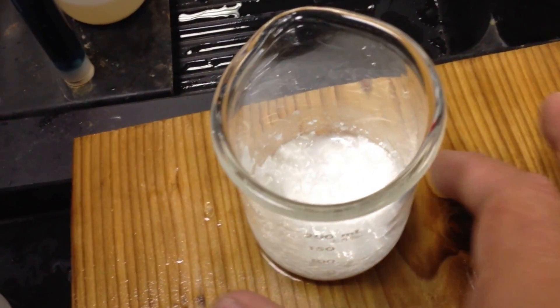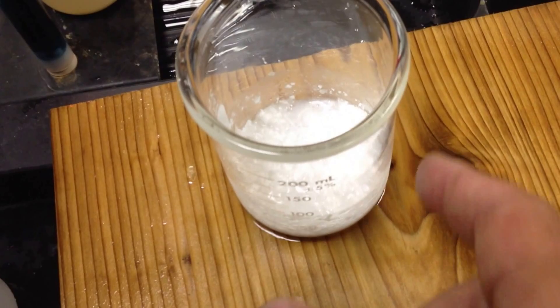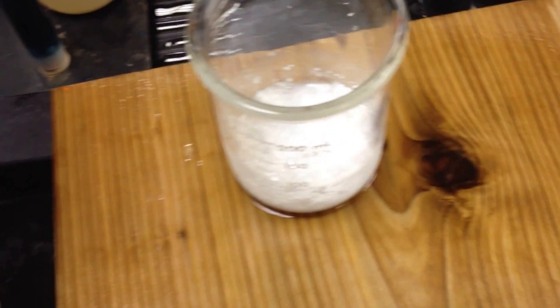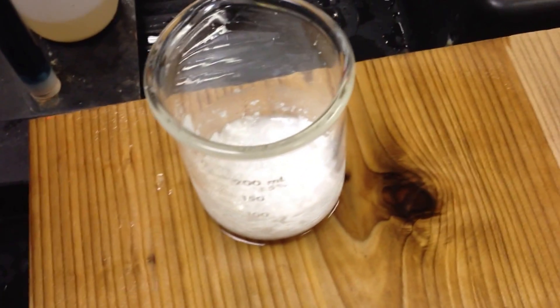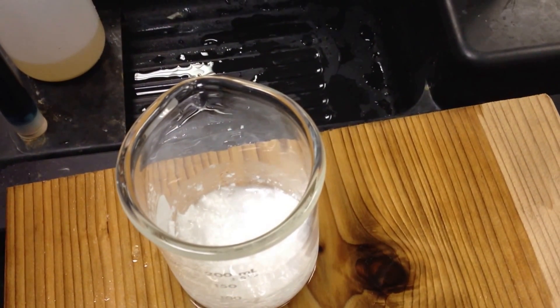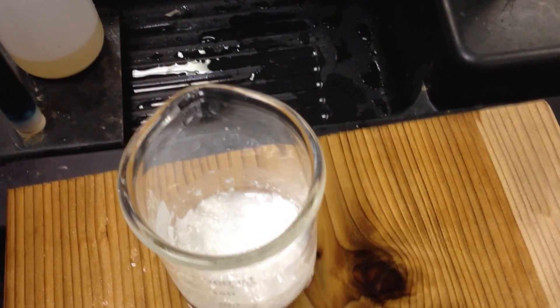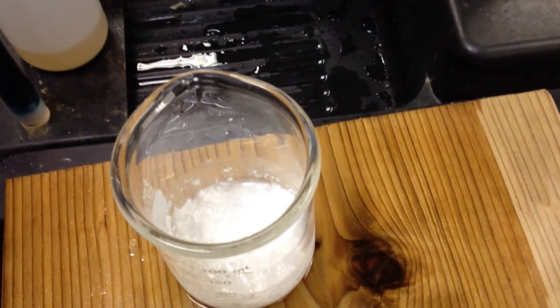But if you were to feel it very carefully, feel it, feel it end. I'll hold this. Can you do two things? It's cold. It's very cold. Why is it cold? Because it lost energy. It took energy from the environment in this endothermic reaction.